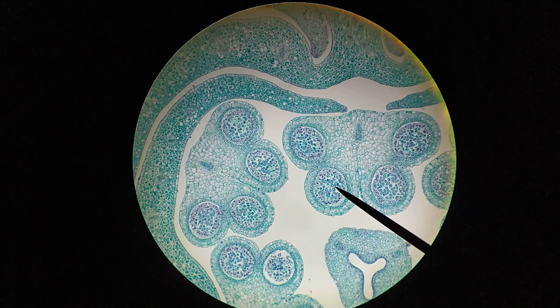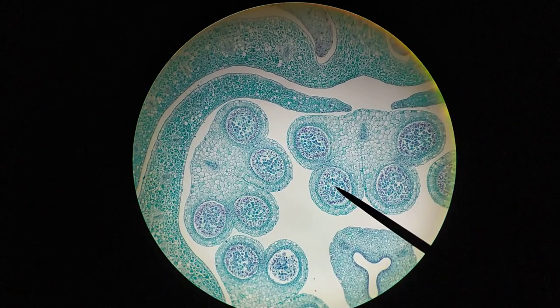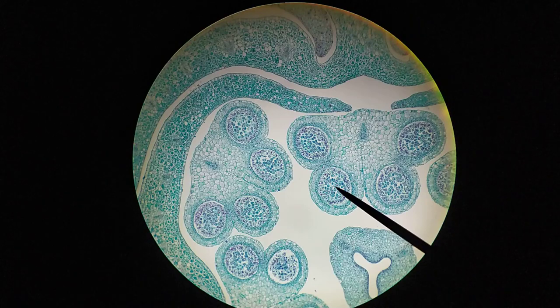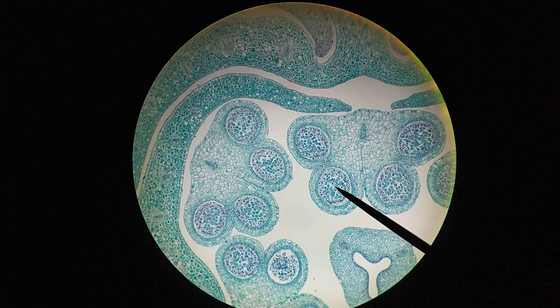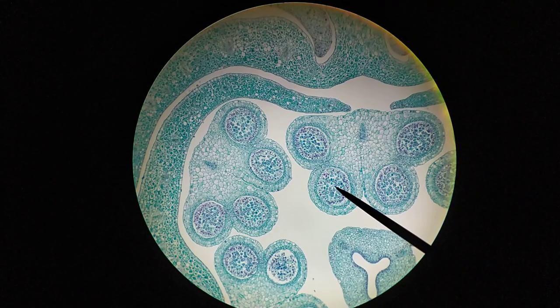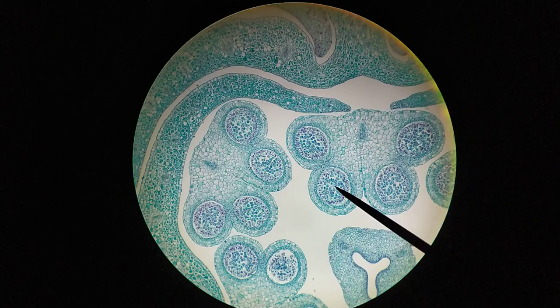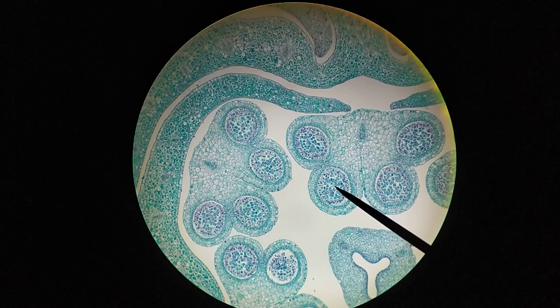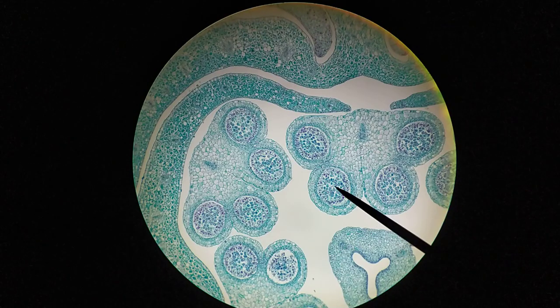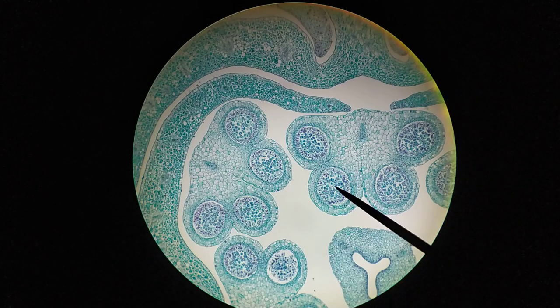These locules contain meiotic cells called microsporocytes. Around the outside of these circular structures are supporting cells called the tapetal cells. We're not going to be looking at those — we're going to be focusing on the round, kind of detached-looking cells found in the middle of these locules.